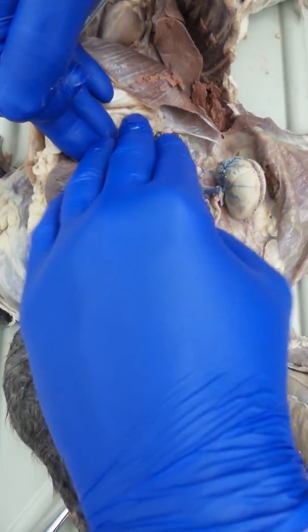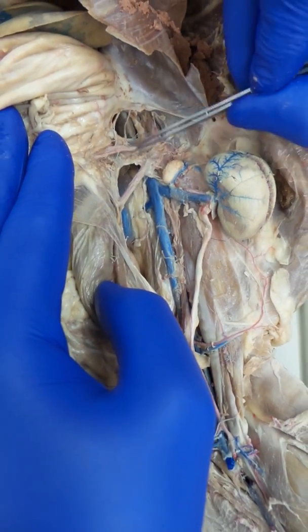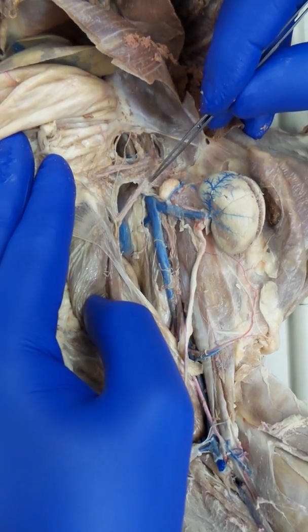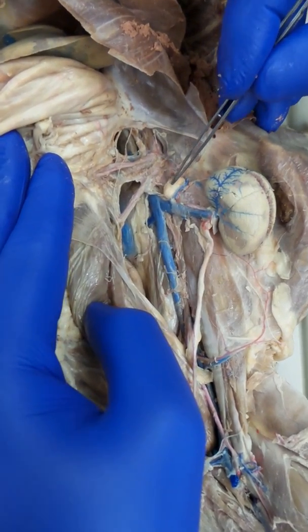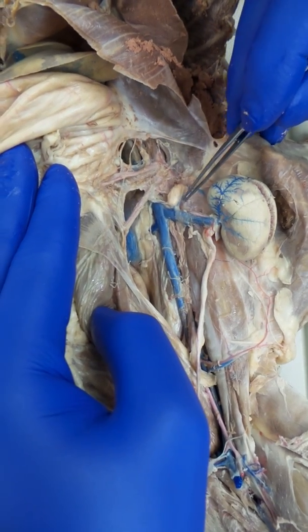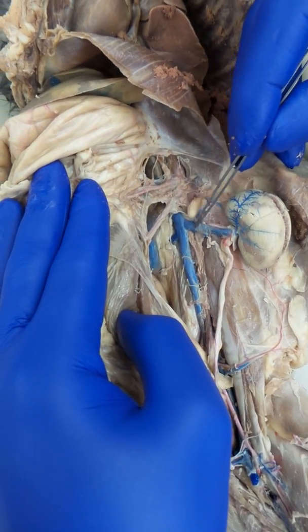We'll get to those in a moment. But looking at the vessels, pull things up. The first vessel you can see is your celiac artery, and then your superior mesenteric. Coming off of there is the adrenolumbar artery. That's the adrenal gland. Right there is the adrenolumbar vein. Oftentimes that vein is coming directly off the inferior vena cava, but this time it's coming off of that renal a little differently.